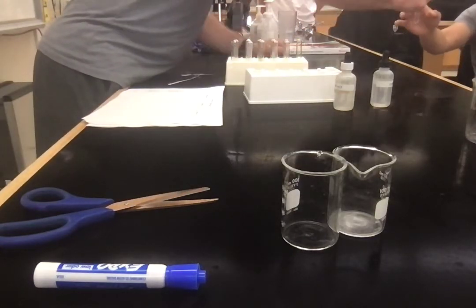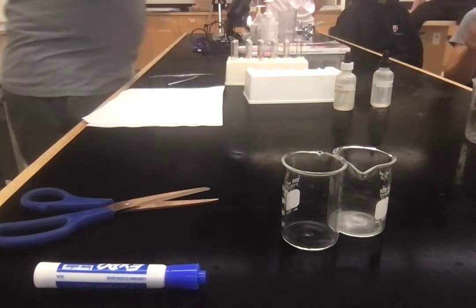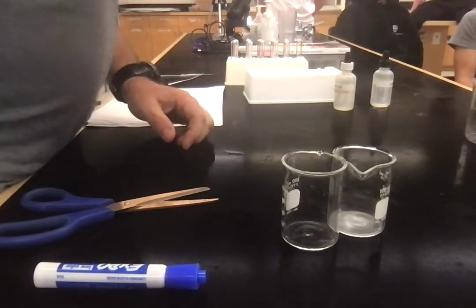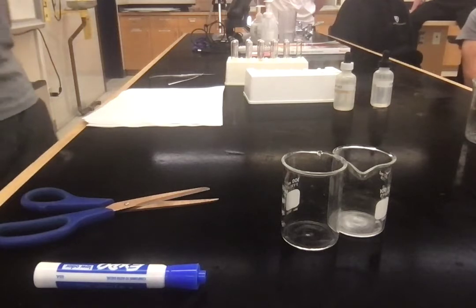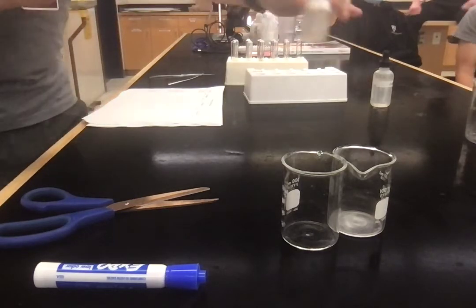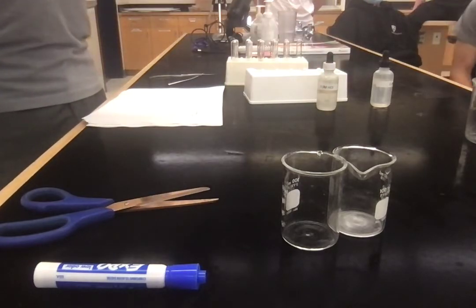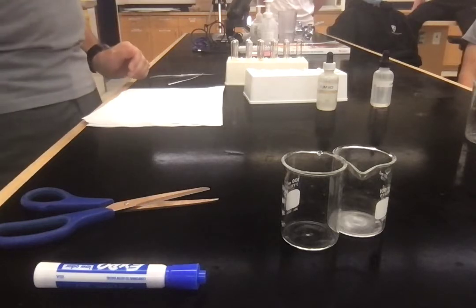Where it's bubbling. Oh, yes. Pretty hot, right? Yes. That's quite warm. The top part, what do you see? Condensation. Yeah, okay. So that's obviously because this solution of HCl is in water. So that top part is bubbling, the heat is making it evaporate, and then it's condensing on the sides.